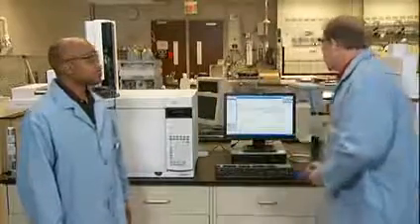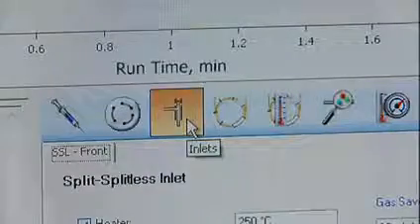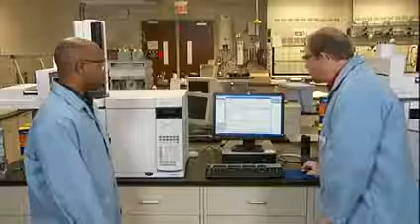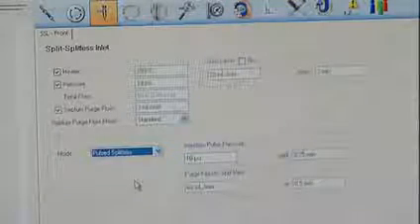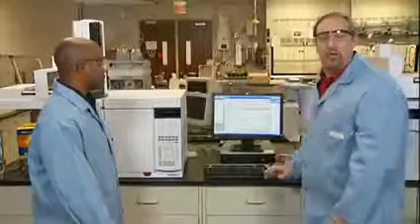Pressure pulsing is done by setting the injection mode to one of the pulsed modes, either pulsed splitless or pulsed split. A window will open up to ask you what pressure you would like to do. We simply go into the inlet section and we notice there's 4 modes: split, splitless, pulse split, or pulse splitless. We set it to one of the splitless pulsed modes, and now we have to determine how high of a pulse do you want to go.